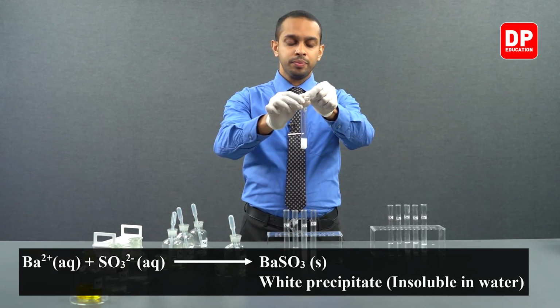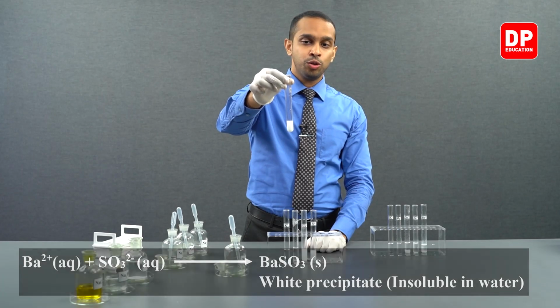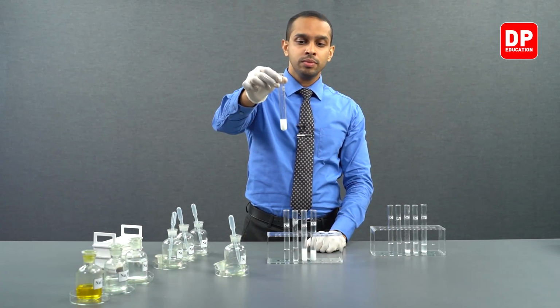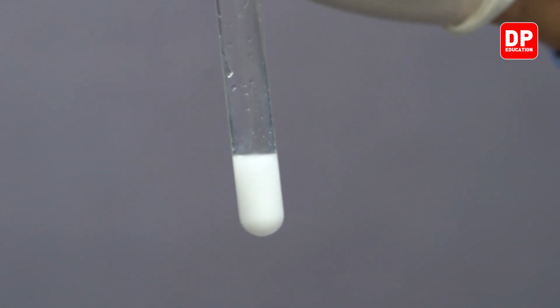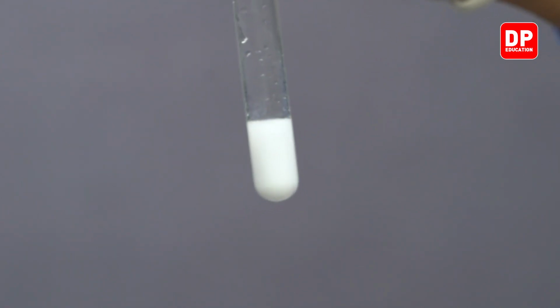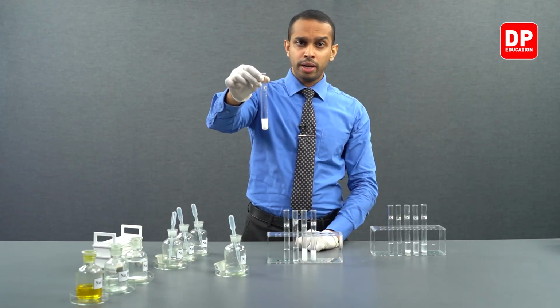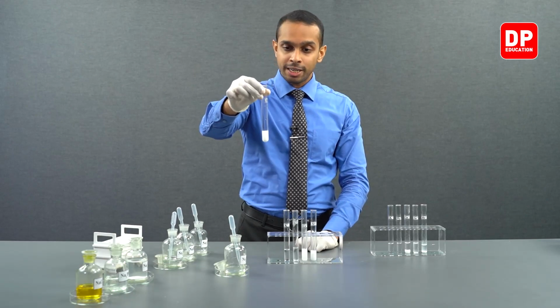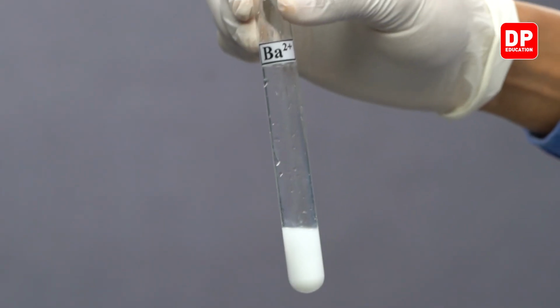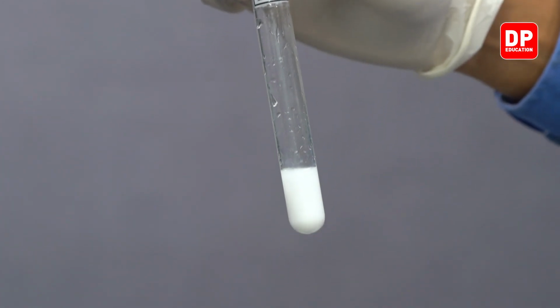You can see as we added sulfite ions into barium 2+ aqueous ion medium, we formed a white color precipitate as seen before in the previous example as well. Barium 2+ when in contact with sulfite ions will form barium sulfite, which is a white color water insoluble precipitate.